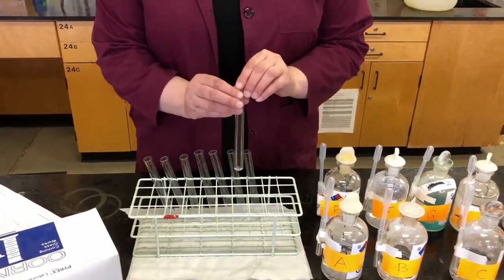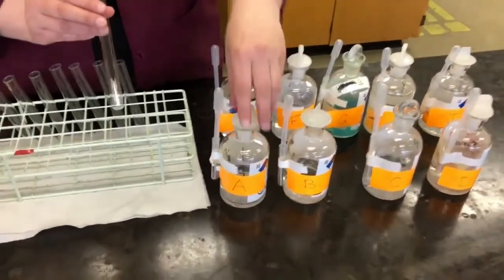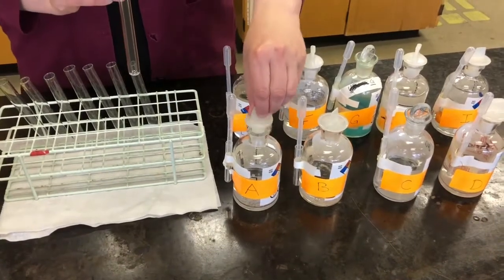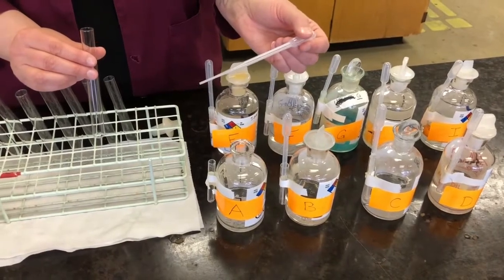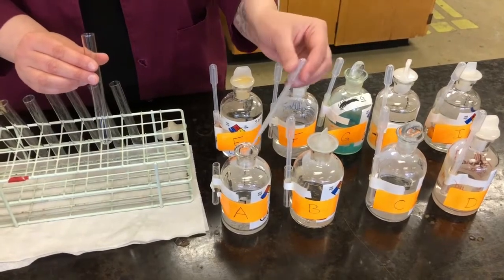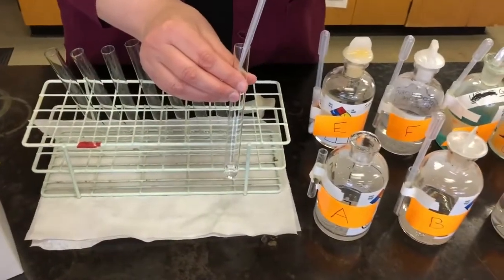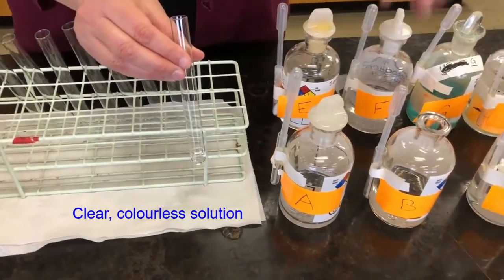We're going to start off with the first reaction, which is A plus B. You can see that the solutions here are A and B. Both of these solutions are clear, colorless solutions. I'm just going to take 1 milliliter of each solution and put it in my test tube. I'm using a disposable pipette to measure out 1 milliliter. It's not exactly 1 milliliter, but it's close enough for this type of experiment. If we were doing a different experiment, we may need to use something more precise. So 1 milliliter into our test tube, and you can see that it is a clear colorless solution. That's A. Now I'll take B.